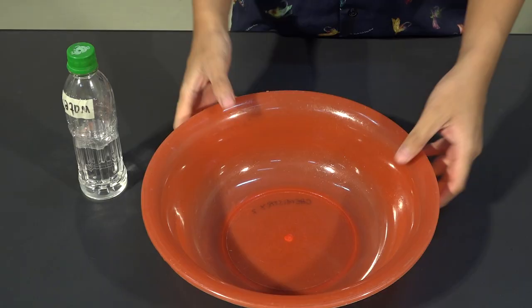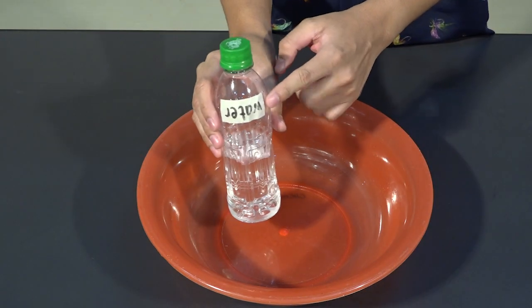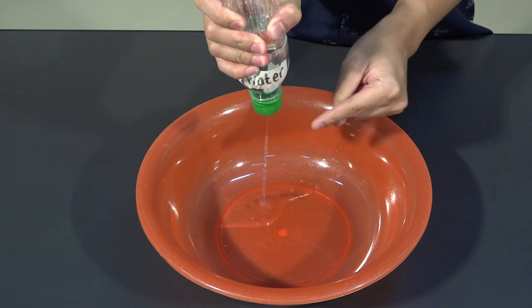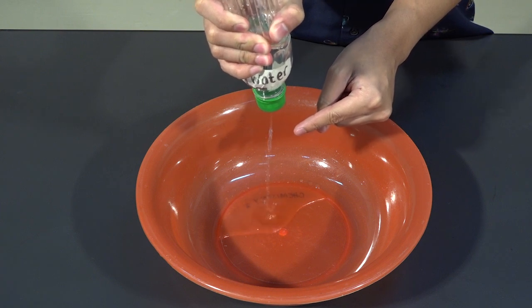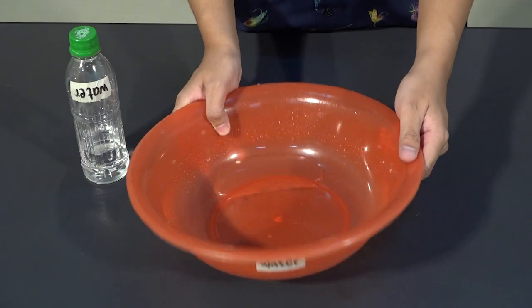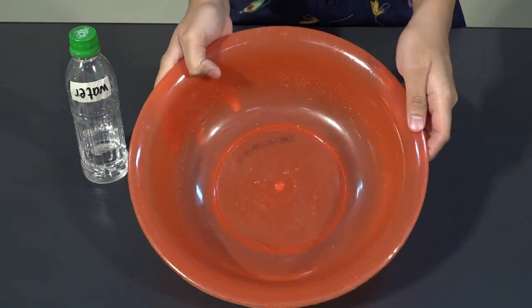charged our ruler. Next, prepare a clean, small labeled basin. Then the PET bottle containing water, turn it upside down and squeeze it to produce a steady, fine stream of water. Can you see the fine stream of water? Make sure to catch all that water dripping into the clean, labeled basin. Label the basins with the name of the liquid sample. The liquid samples can be reused at a later time or in case the PET bottle needs to be refilled.